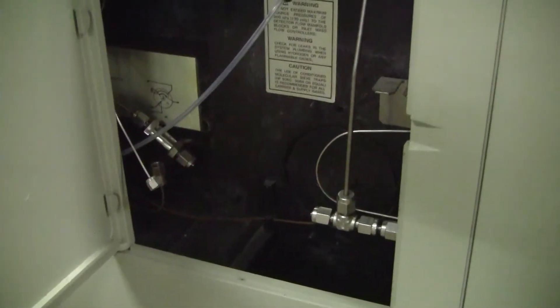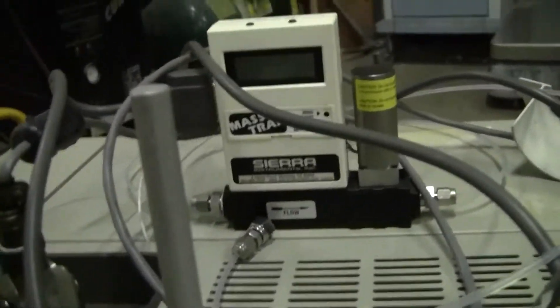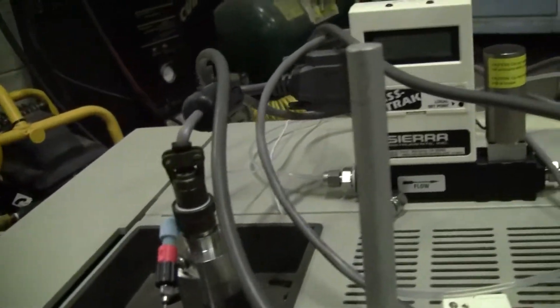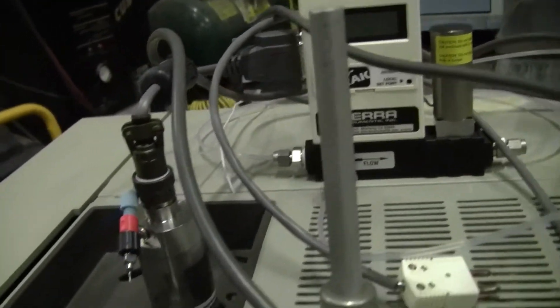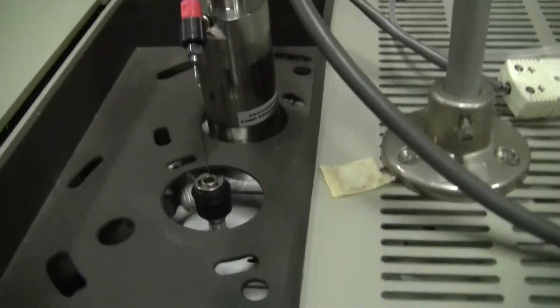You're going to need to do some plumbing on the side. All right. They put a mass flow controller so they were obviously trying to inject something into it, and they customized it a little bit.